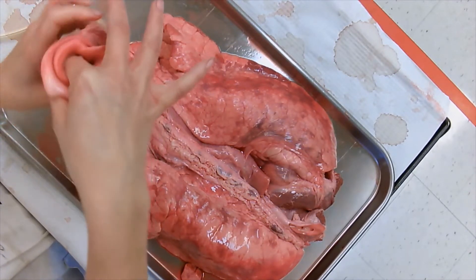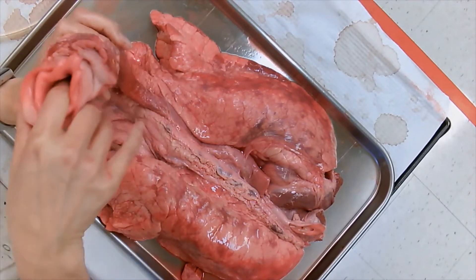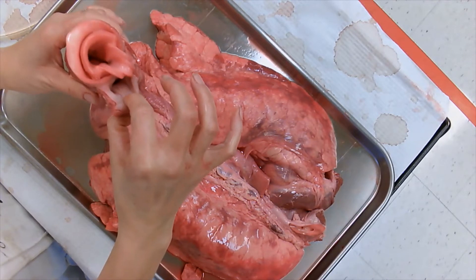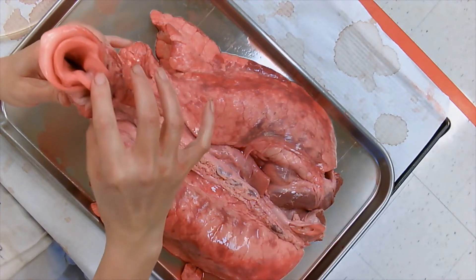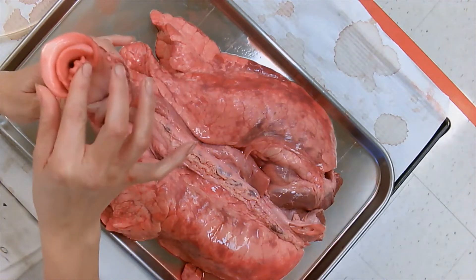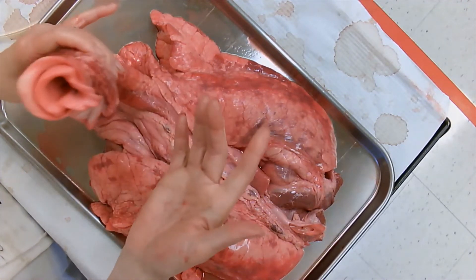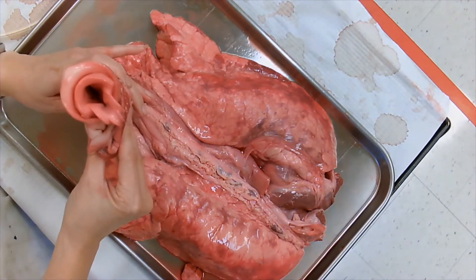The airway goes through inside here, and right here this is the esophagus — this is where the food goes. So the epiglottis is right there and it blocks this opening so that food can actually go into the esophagus and not the airway.